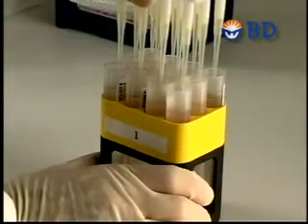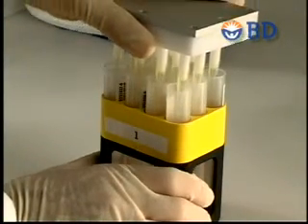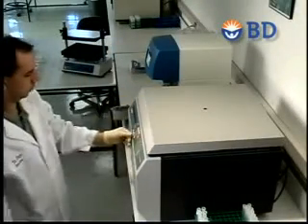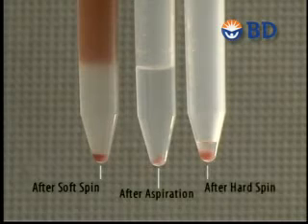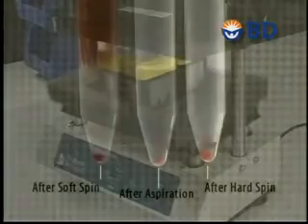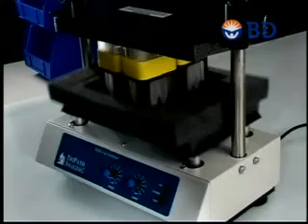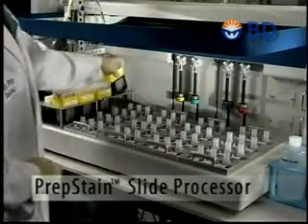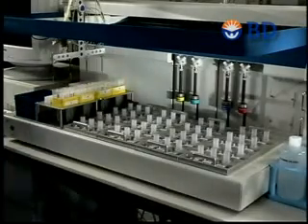Once the soft spin is complete, the supernatant fluid containing the obscuring materials is removed. Then the second centrifugation, a 10-minute hard spin, occurs, and excess fluid is removed, leaving an enriched cell pellet. The samples are then vortexed and are now ready to go onto the PrepStain slide processor. Centrifuge buckets containing tubes are loaded directly into the PrepStain sample area. Labeled slides are placed directly onto the PrepStain slide processor.